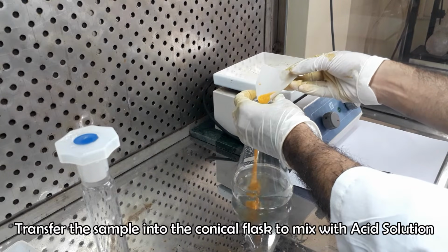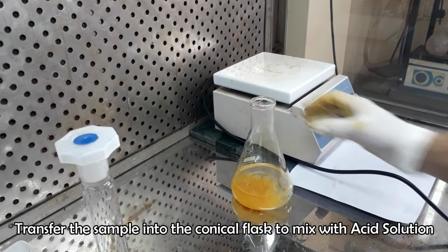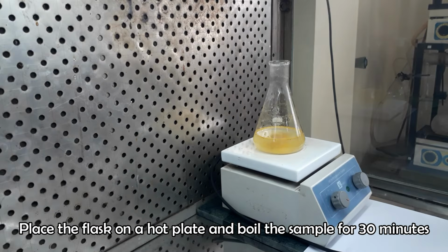Add the sample in the conical flask and rotate to mix with the acid solution. Place the flask on a hot plate and boil the sample in acid with periodic agitation for 30 minutes.